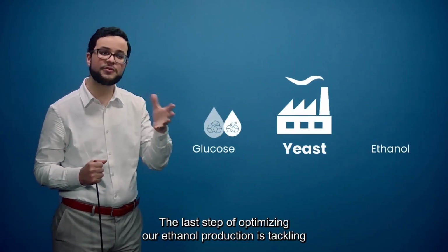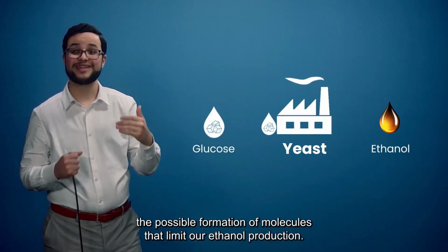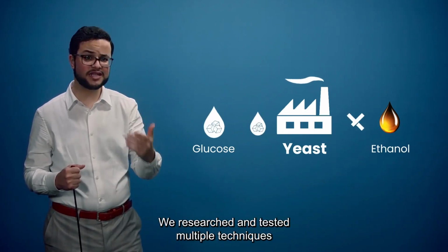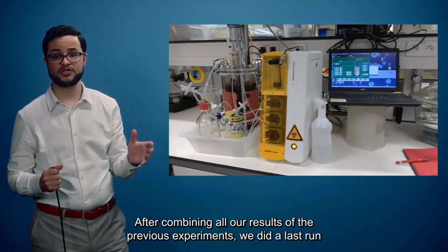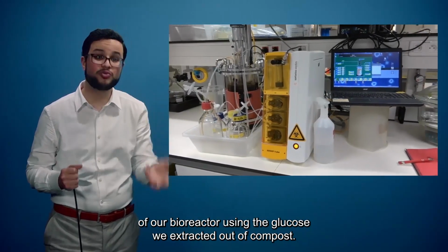The last step of optimizing our ethanol production is tackling the possible formation of molecules that limit our ethanol production. We researched and tested multiple techniques to reduce the effects of inhibitors like furfural. After combining all our results of the previous experiments, we did a last run of our bioreactor using the glucose we extracted out of the compost.